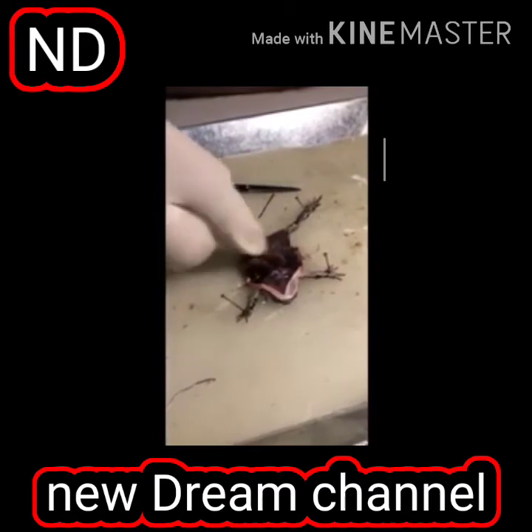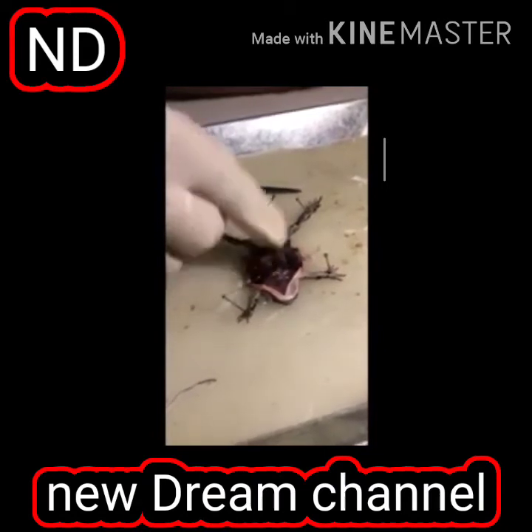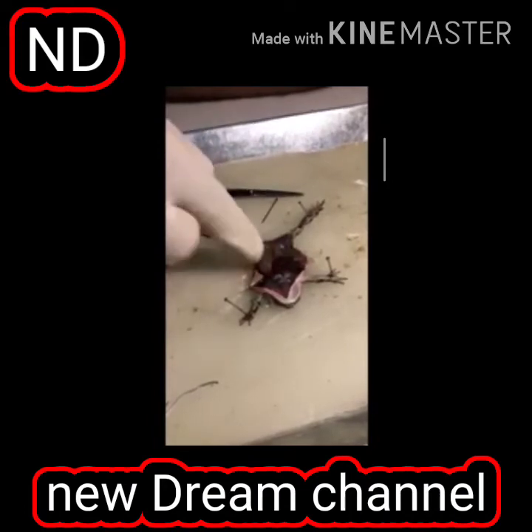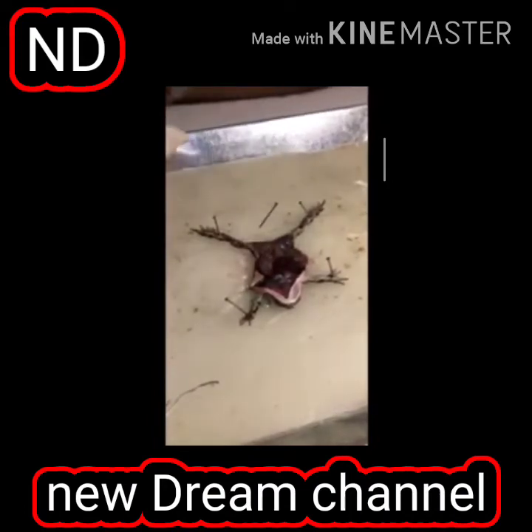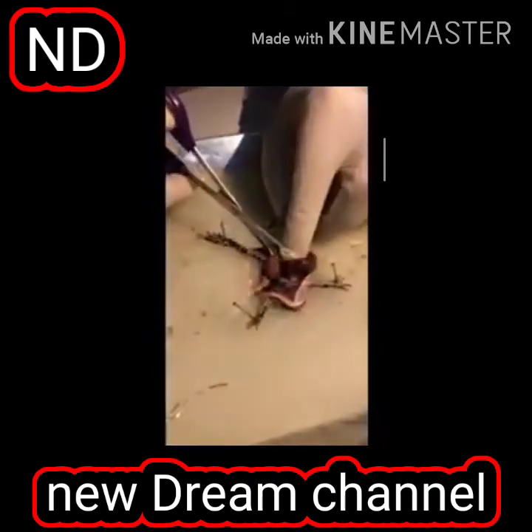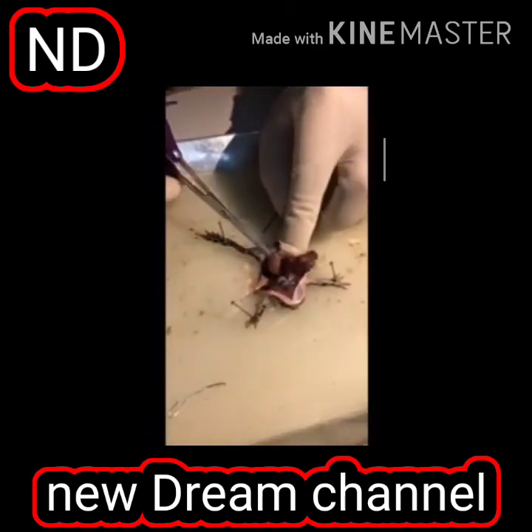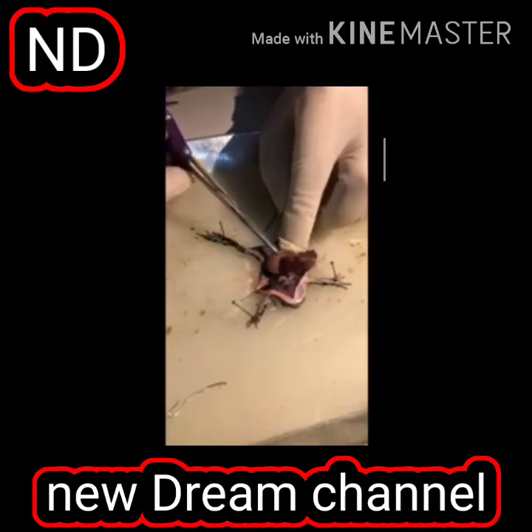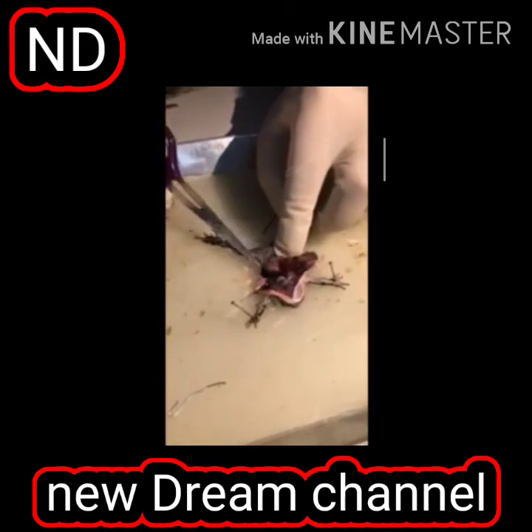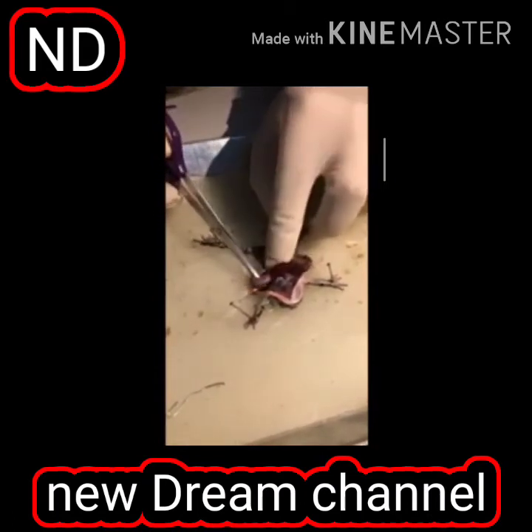The lungs here, these are intestine, and this is stomach here. If you see, this is the stomach, proper stomach. If you want to see the stomach, I can cut it. I can cut the stomach for you. I can take it away.